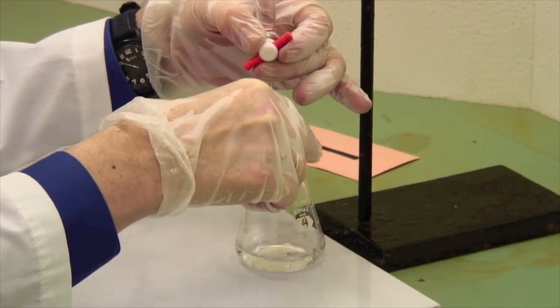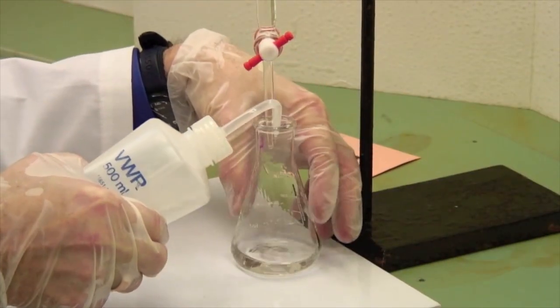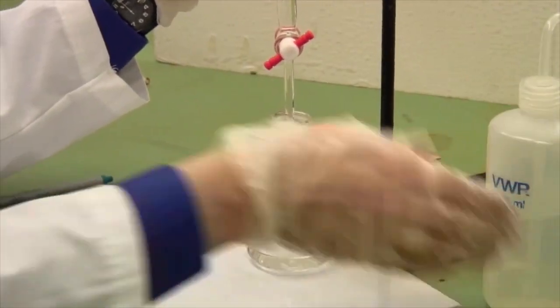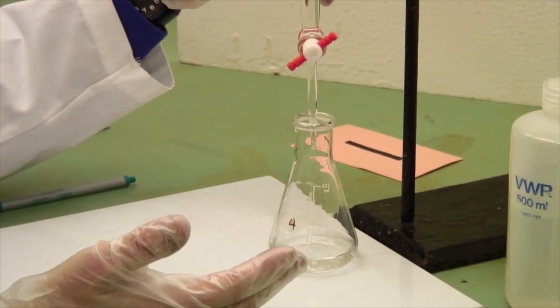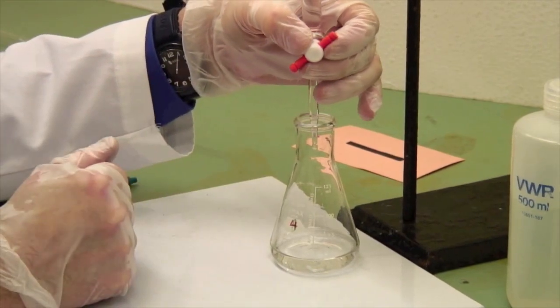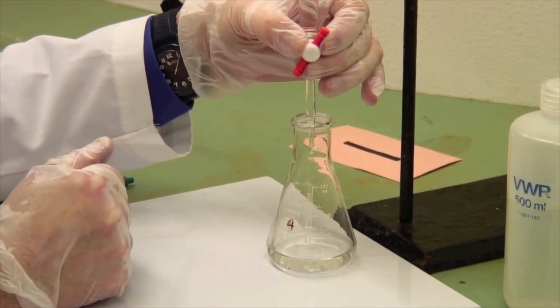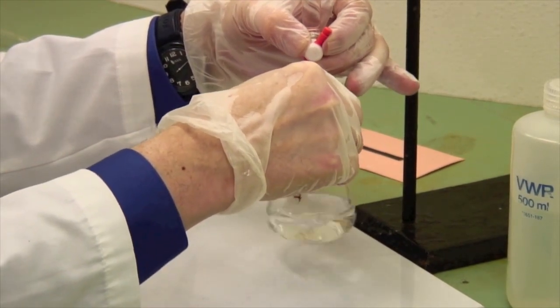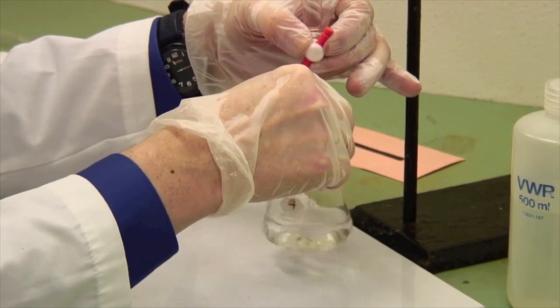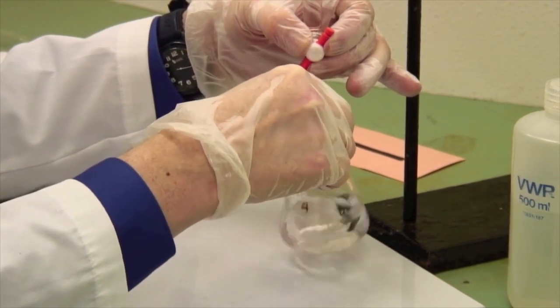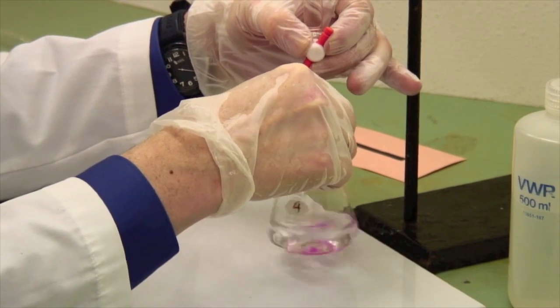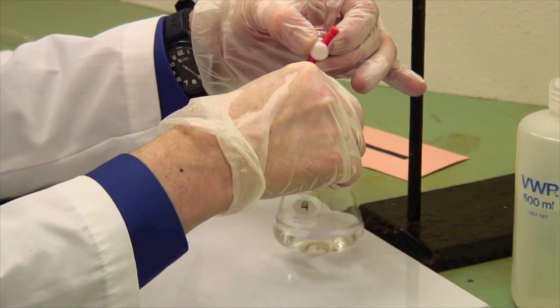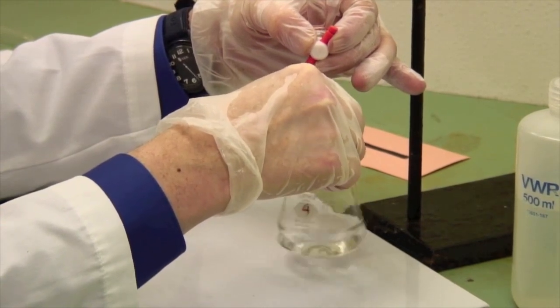It's a good idea, every so often, to wash down the sides of your vessel. Now, the distilled water has nothing in it, no H+, no OH-, so the volume of distilled water added is not significant. Notice also that we're doing this over the top of a white titration background. It's almost impossible to see the color changes against a darker colored bench, which is why you've got these white backgrounds available for you.